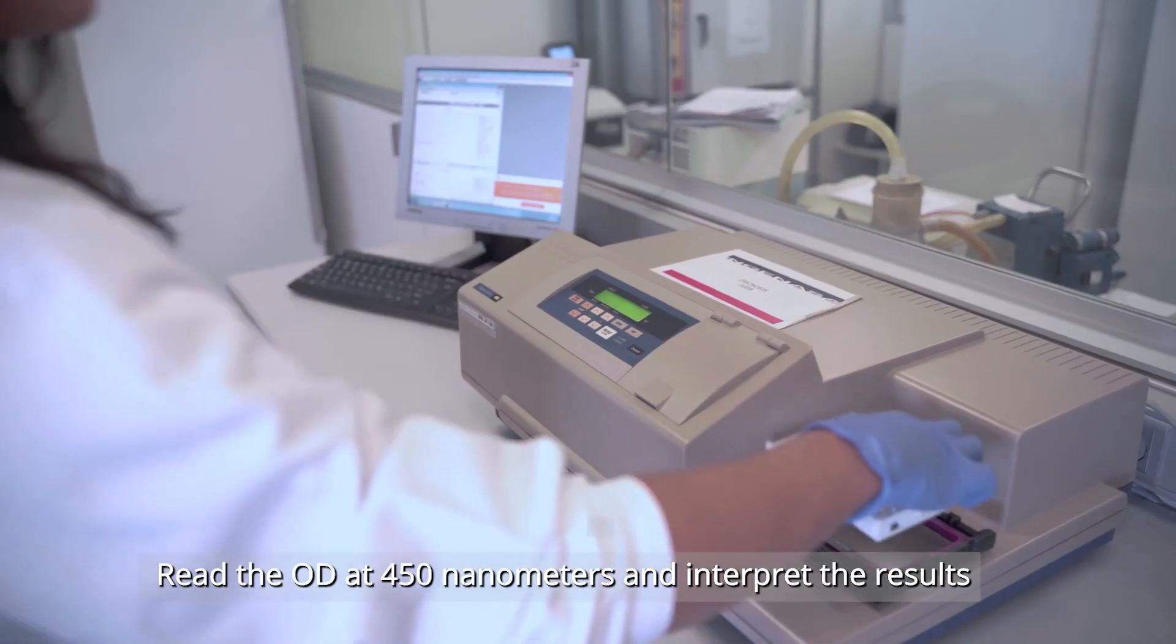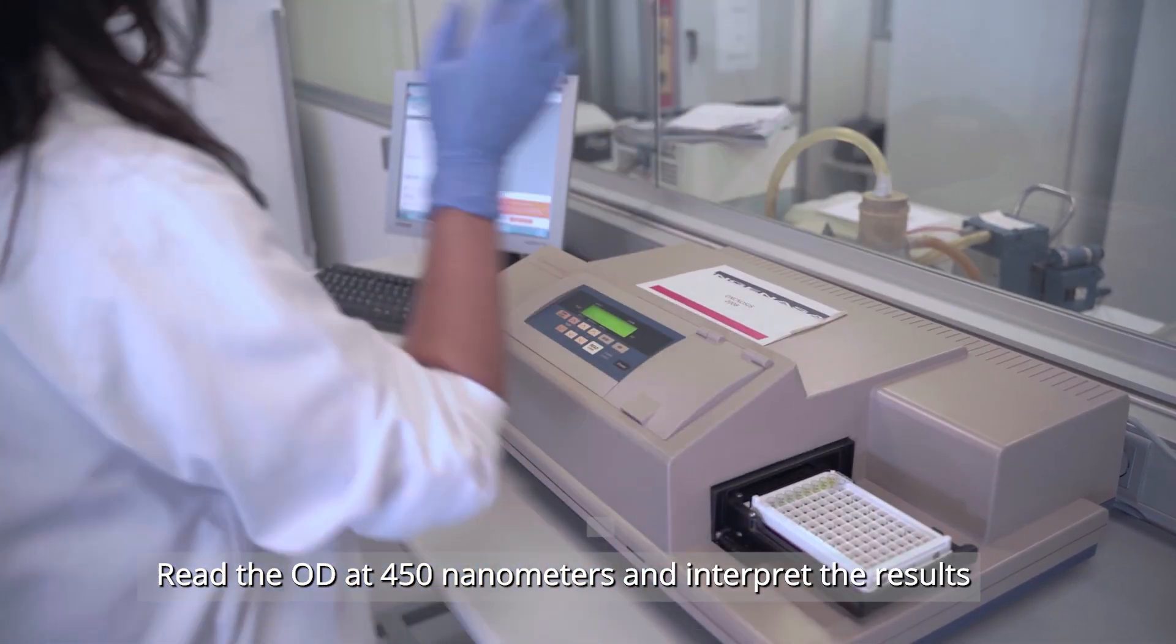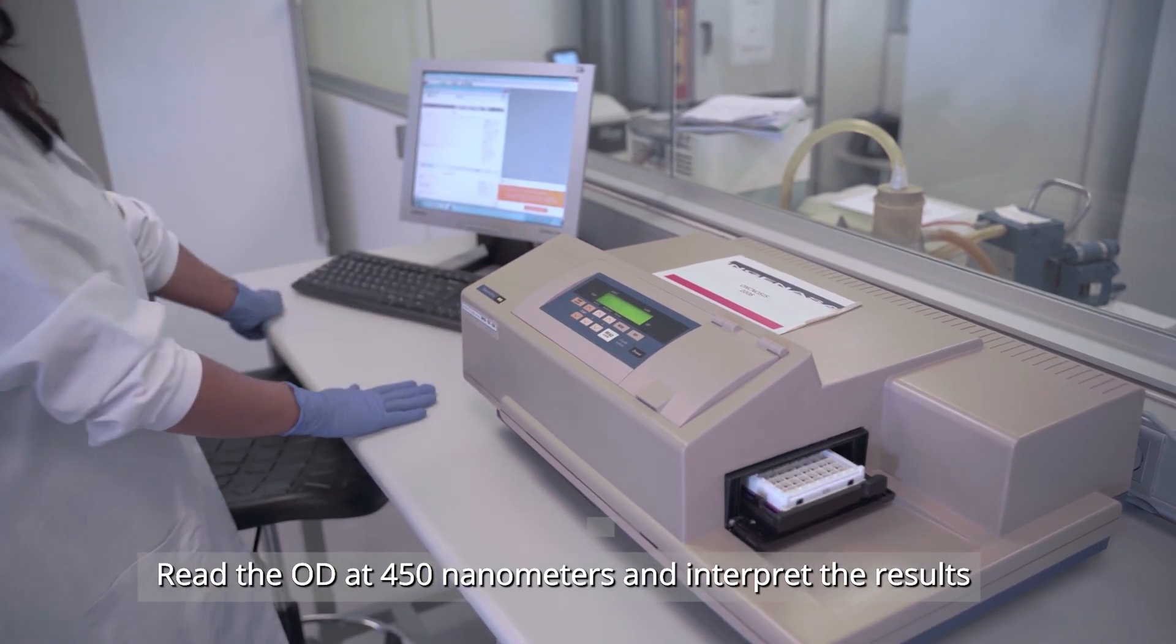Read the optical density at 450 nanometers and analyze the data to obtain a quantitative result.